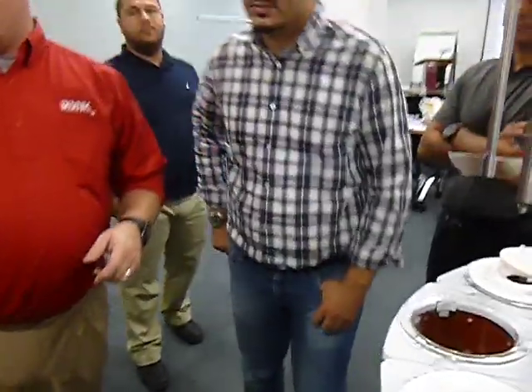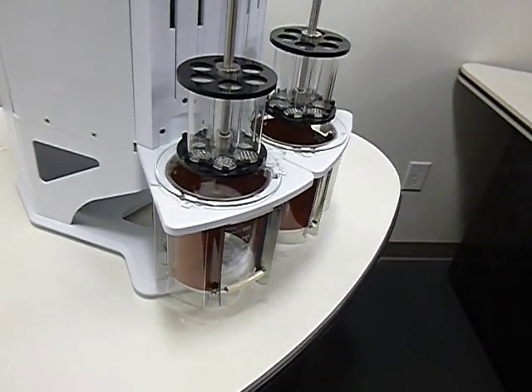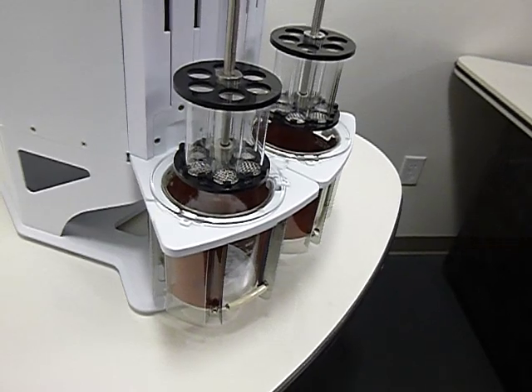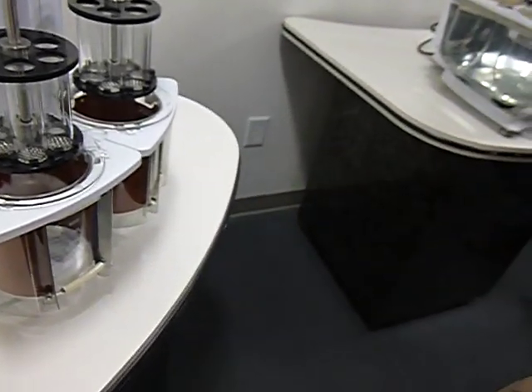That's not true with our disintegration systems. These actually have a sensor built into the heater jacket. So there's two different types of things. I don't know if you guys work on disintegration systems, but the 31 and the 3200 have a sensor built into the jacket. The baths don't have any sensor. The sensors for the baths are all located inside the RTD.